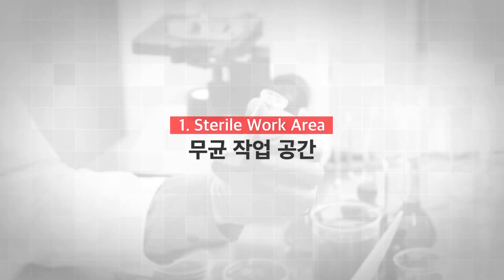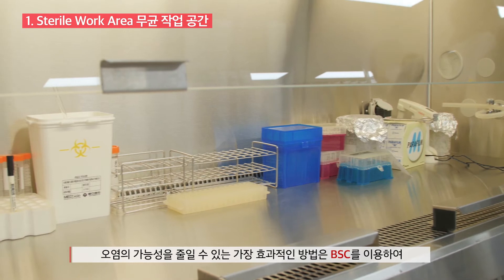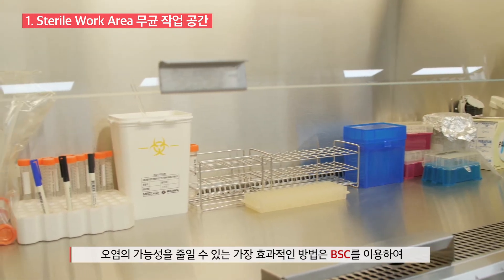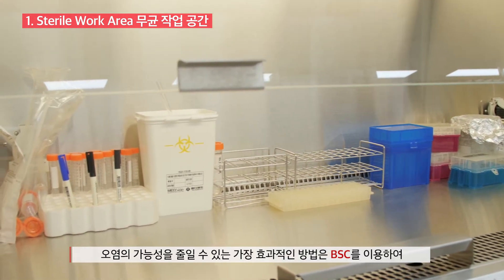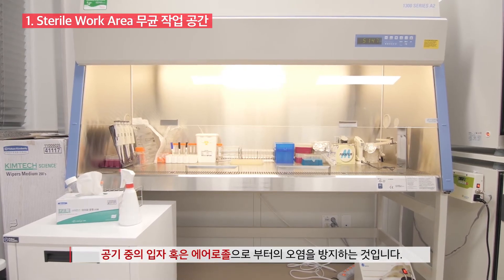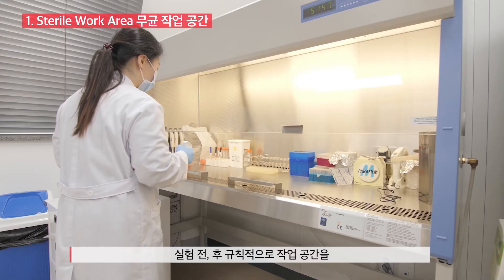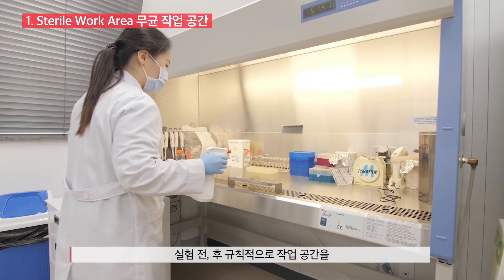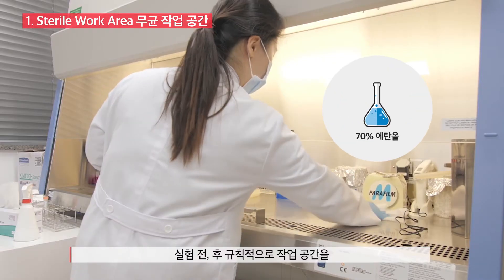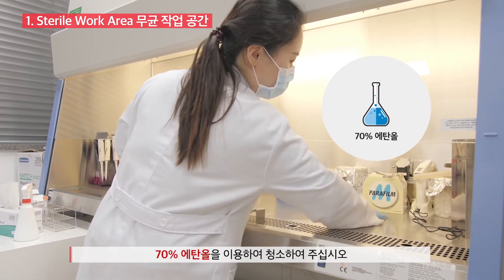First, sterile work area. The best way to reduce the chance of contamination is to use a biosafety cabinet to avoid airborne particles and aerosols. Before and after each use, routinely wipe the work surface with 70% ethanol.